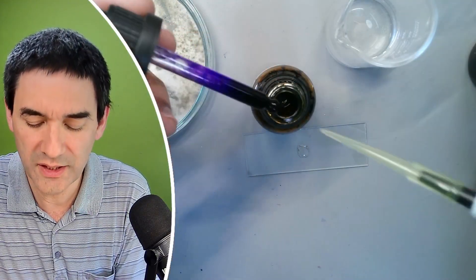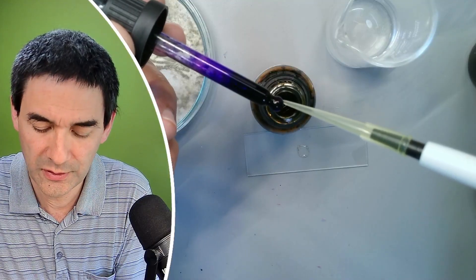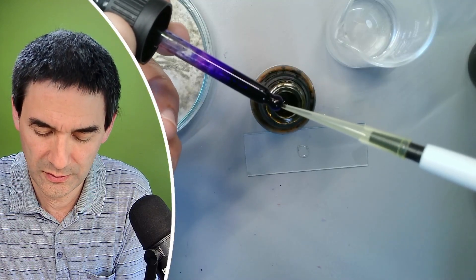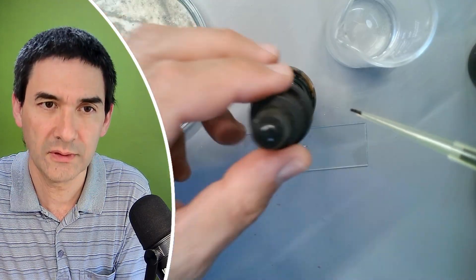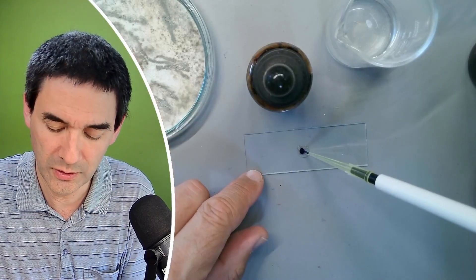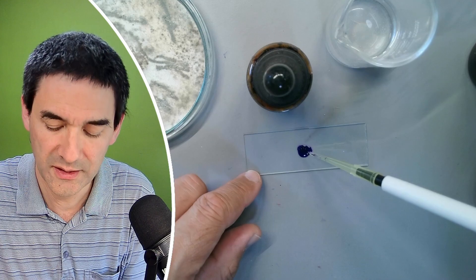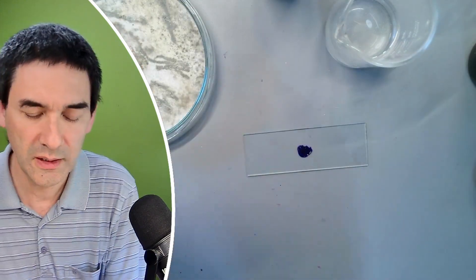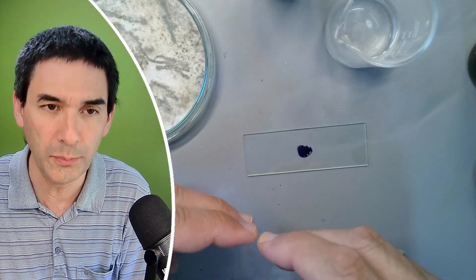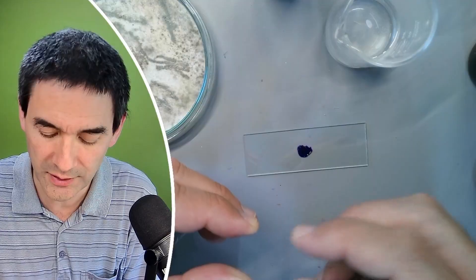Maybe that's enough and we're going to properly mix it. You see it's still quite dark. And now a cover glass goes on top and we're going to have a direct look under the microscope.